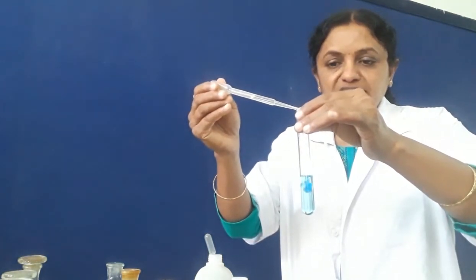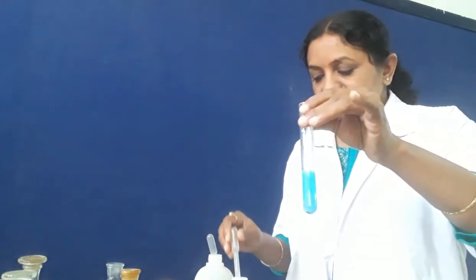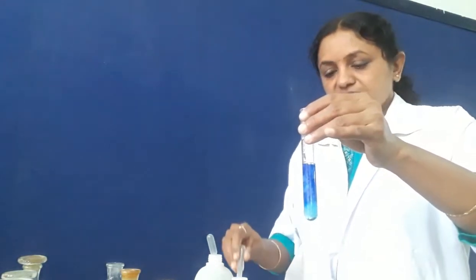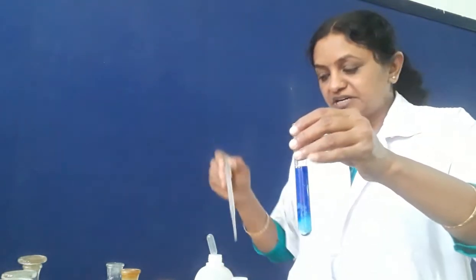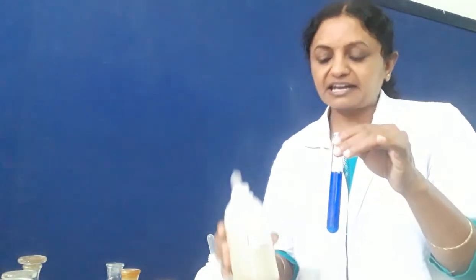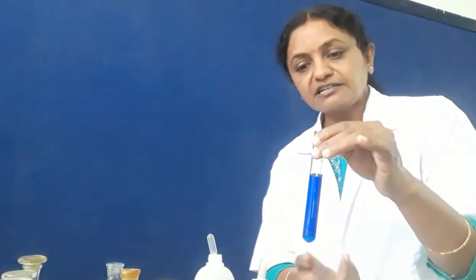In the second test tube we add a very little amount of NH4OH and we get a pale blue precipitate. Now when you add excess of NH4OH, a very beautiful color appears: it is an inky blue solution — the precipitate is dissolved. This is tetraamine copper sulfate. Cupric hydroxide is soluble in excess NH4OH, giving a deep blue or violet inky blue solution. A complex soluble salt is formed.